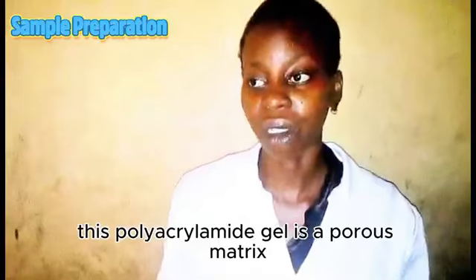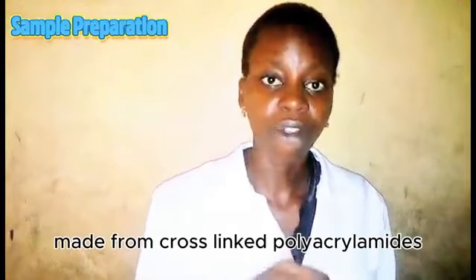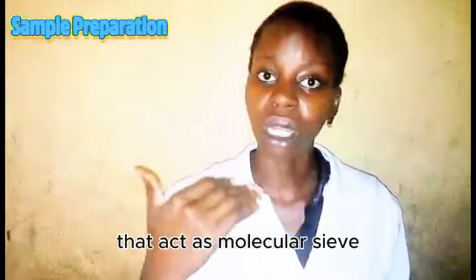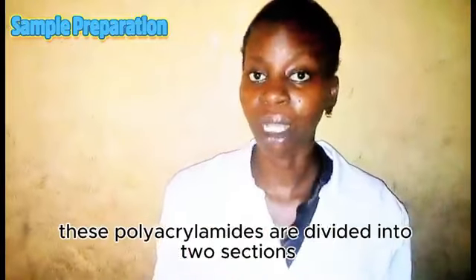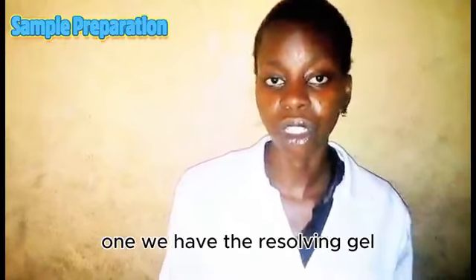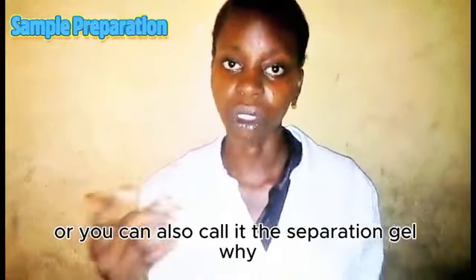This polyacrylamide gel is a porous matrix made from cross-linked polyacrylamides that acts as a molecular sieve. These polyacrylamides are divided into two sections. One, we have the resolving gel, or you can also call it the separation gel, while secondly, we have the stacking gel.